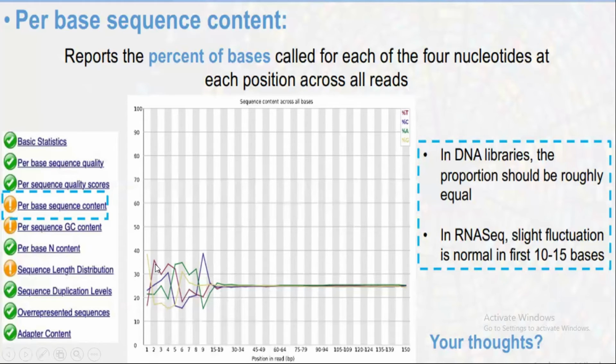So when they are shown in your FASTQ file, it will give you such a result. And after that, what will you do? You have to remove the adapters and other such content, the contamination and so on. After that, you will see that this does not appear. Okay, so I will show you how to pre-process it, but just keep the concept in your mind.